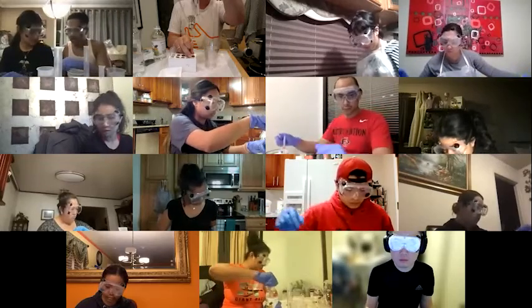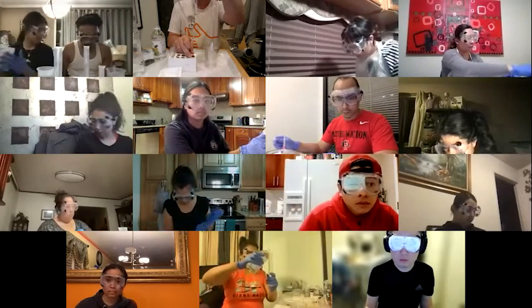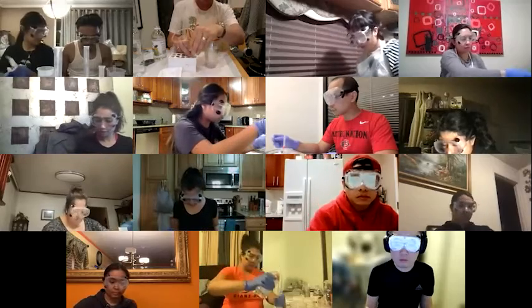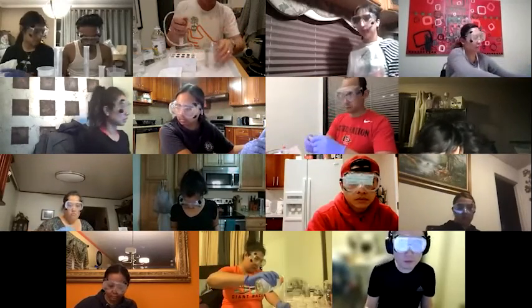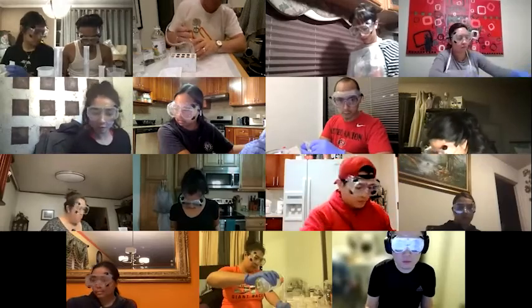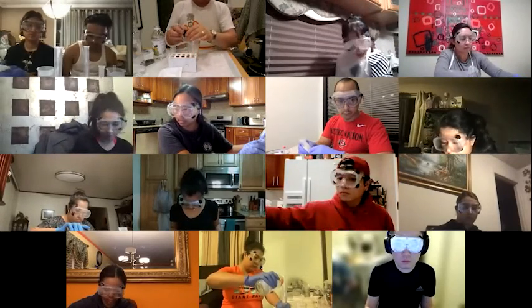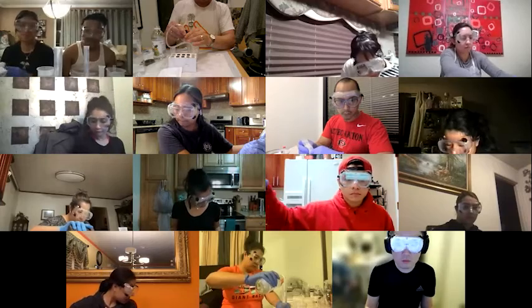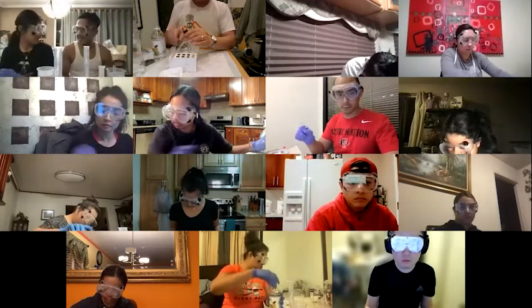Yeah, supposedly this takes about 10-15 minutes to occur. So let me just add a little more and then just let it sit. Oops.